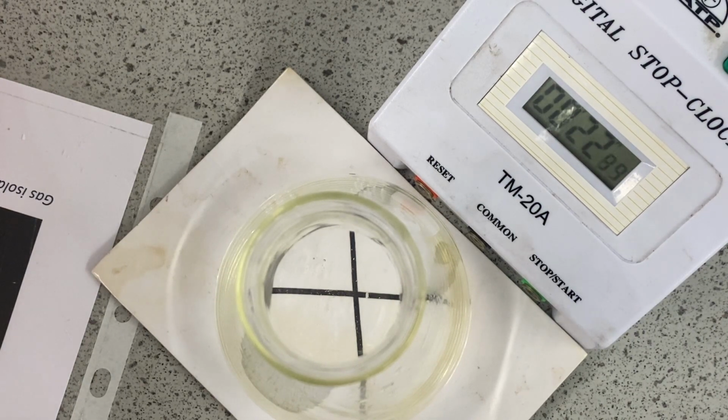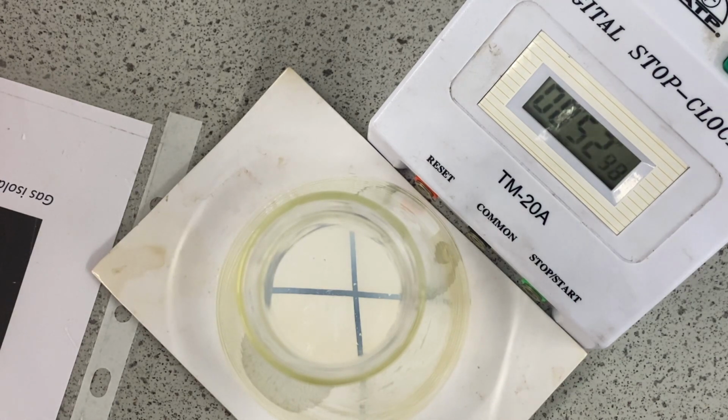While we wait, you can see the timer going up there, so we're already nearly at 30 seconds, and there doesn't appear to be much happening yet, but give it time. In this experiment, the things that we've needed to keep the same are the volume of the hydrochloric acid and the concentration of the hydrochloric acid, and the volume of the sodium thiosulfate and its concentration. Each time we repeat this experiment, those are 2 of our control variables, and they're the most obvious ones, and in an exam those are the ones that you're probably going to be expected to record.